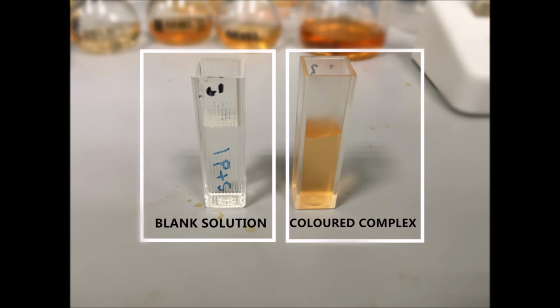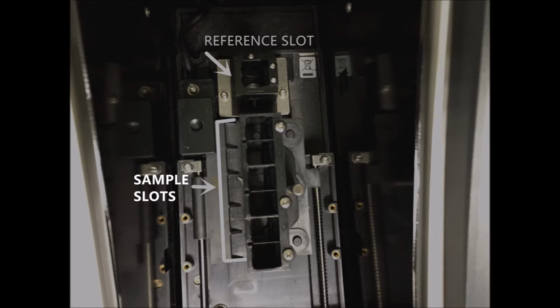Fill 2 cuvette cells, one with the blank solution and one with the colored complex. We chose the most concentrated one as our colored complex. Open the lid of the spectrophotometer and this is what you will see. One separate slot, which is the reference slot, with 6 continuous slots for the samples to be analyzed.